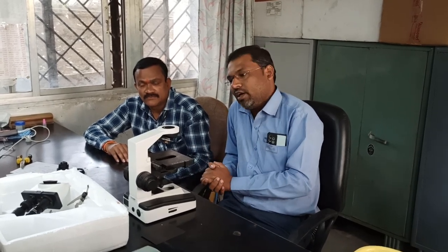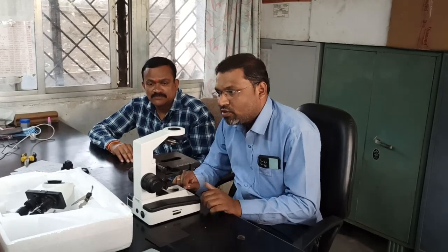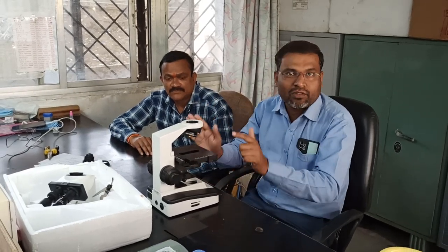Basically, microscopes have three types: monocular, binocular and trinocular. So today I'm going to give you a basic, brief training regarding the binocular microscope. What are the different parts and how to assemble it. See, this is a completely new setup of a binocular microscope. It has different parts available, so we are going to assemble this microscope step by step.